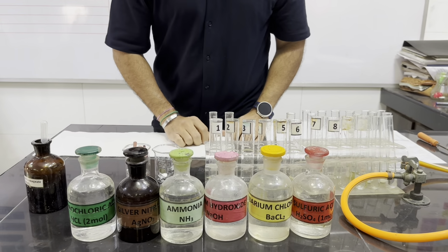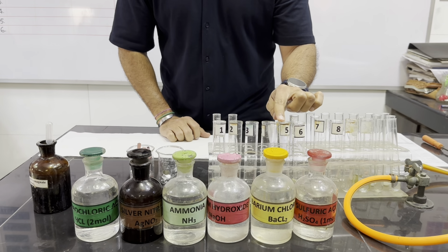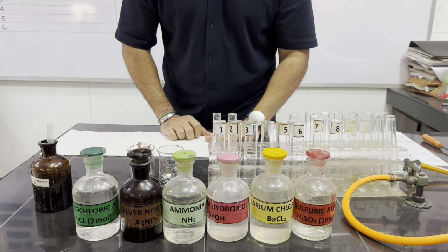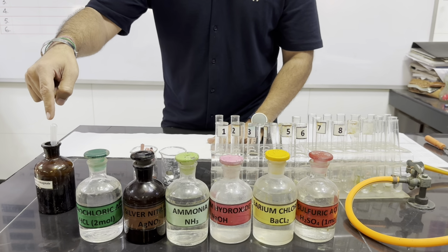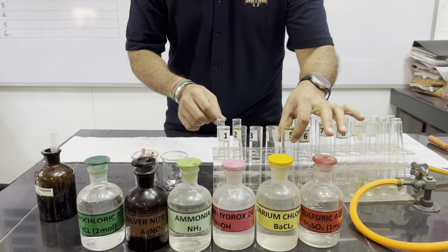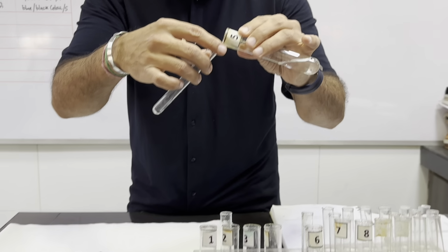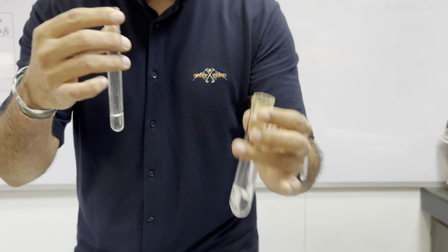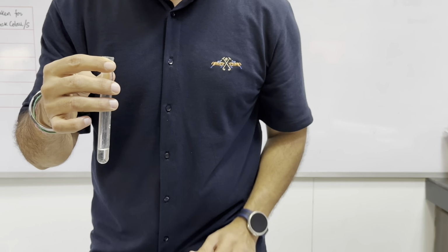Now we are going to differentiate between Fa5 and Fa6, that is nitrate and nitrite, with one more test, and that is with aqueous KMnO4, potassium manganate(VII). Now we are taking 1 centimeter of solution of Fa5 in the test tube, which we have just tested and found contains nitrate.